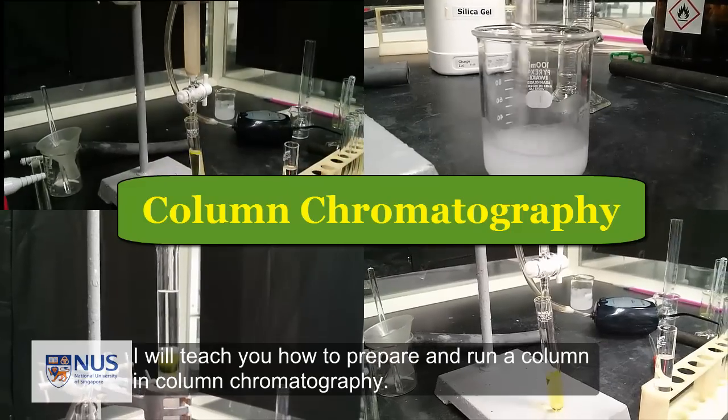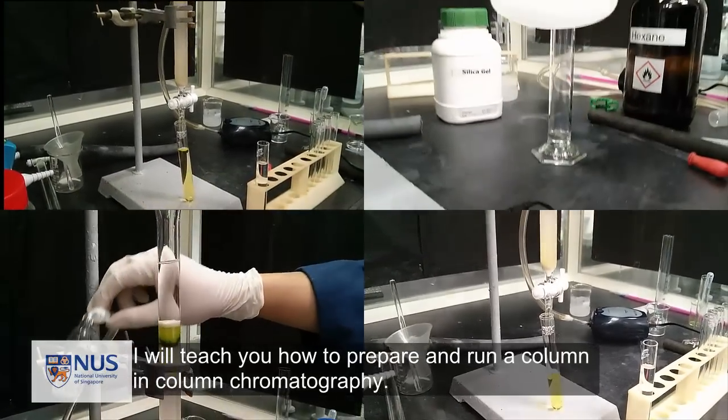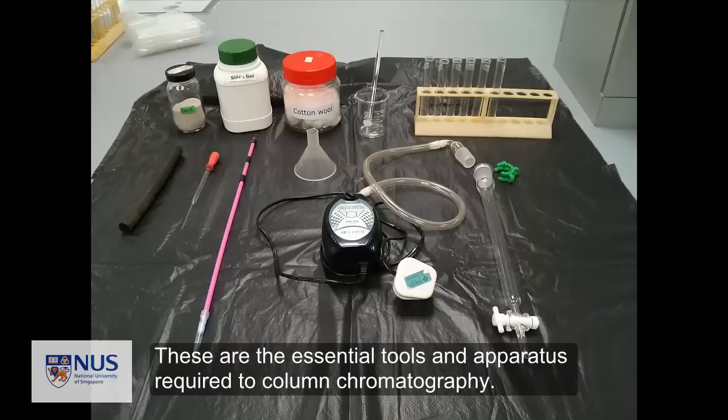I will teach you how to prepare and run a column in column chromatography. These are the essential tools and apparatus required to do column chromatography.